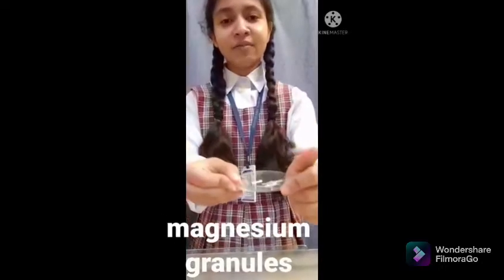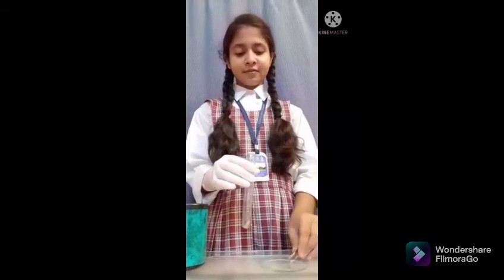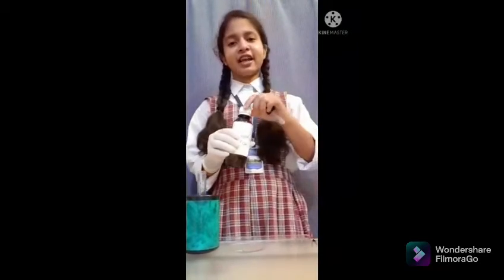For this experiment we need hydrochloric acid, magnesium granules, test tube, dropper, forceps, matchbox and gloves for safety. We will take the test tube and put the magnesium granules inside it. Now with the help of a dropper, we will put the hydrochloric acid inside the test tube.